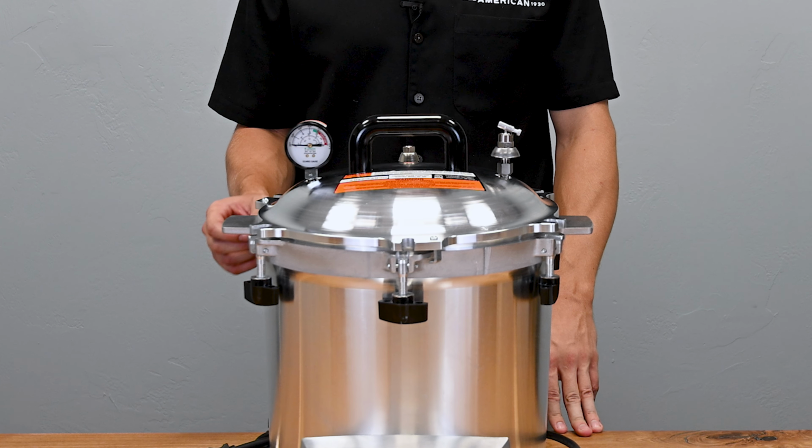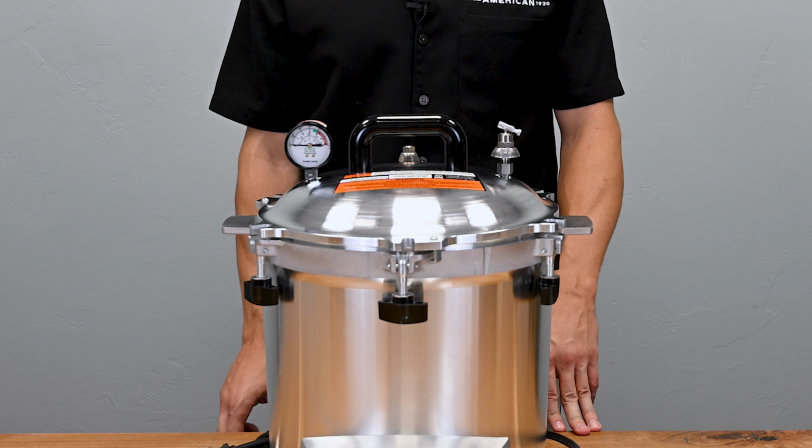Next, we will inspect the overpressure plug. Inspect this for cracks, wear, and debris accumulation. Replace your existing overpressure plug with a new one if you see any of those conditions. Our sterilizers use a bright colored overpressure plug, which differs in the pressure setting from the black one that our pressure canners use. Never replace your overpressure plug with a used one. We recommend replacing this every 6 months, even without visible signs of wear and tear.